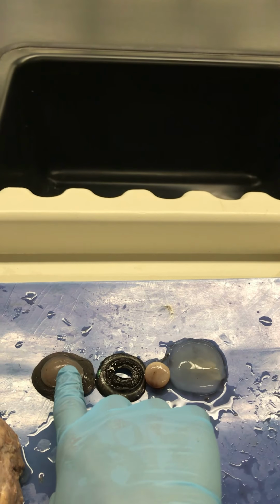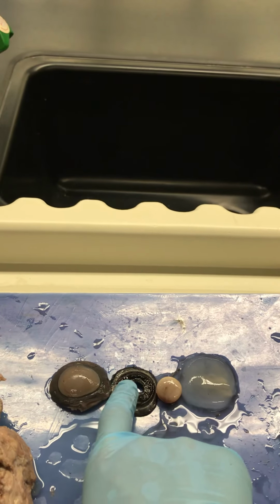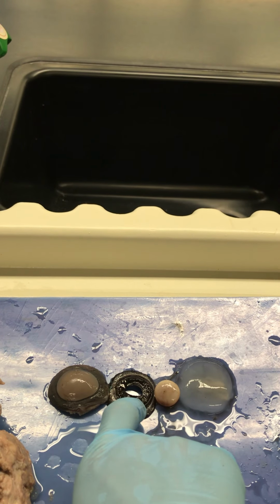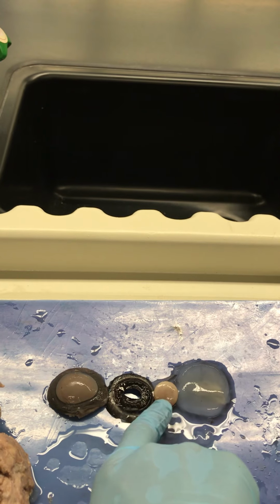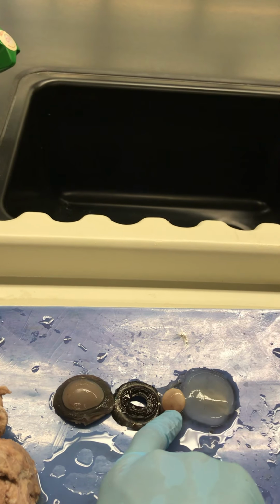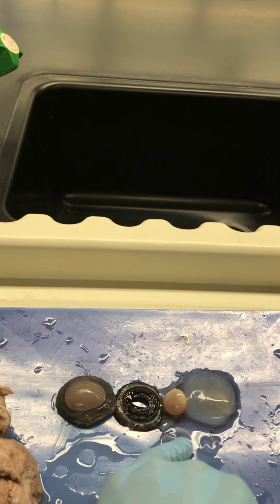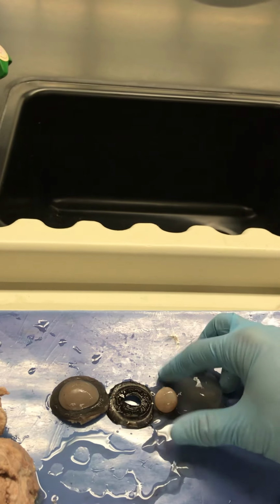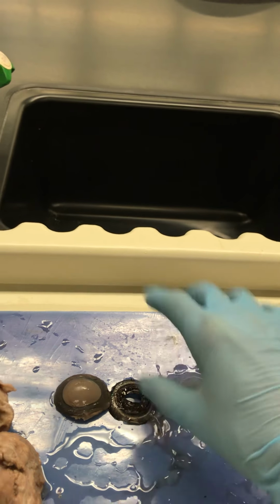We bend light with our cornea, we let the light come through our pupil, and we open and close the pupil with our iris, and then the light bends again, sharper, with the lens, and then the vitreous humour helps to carry that light, further bending it towards the retina.